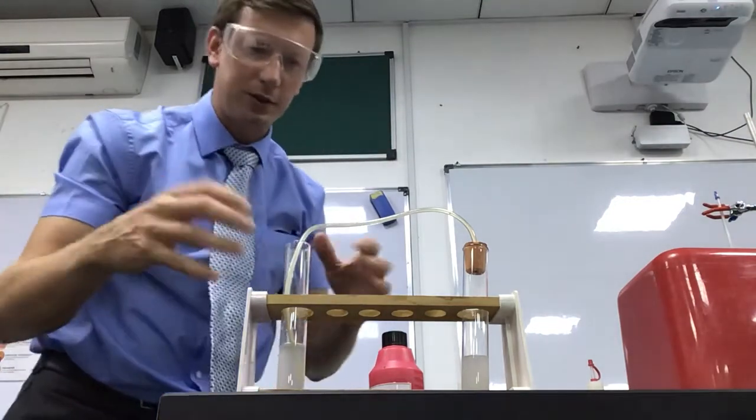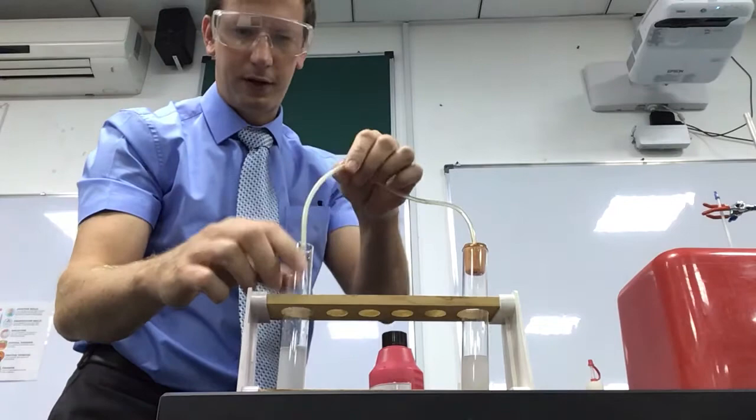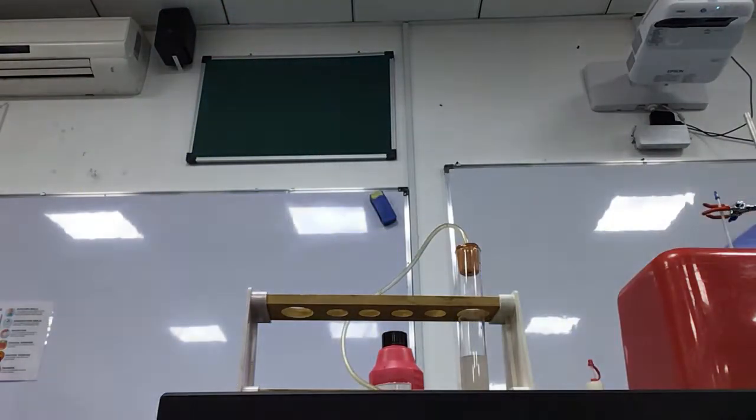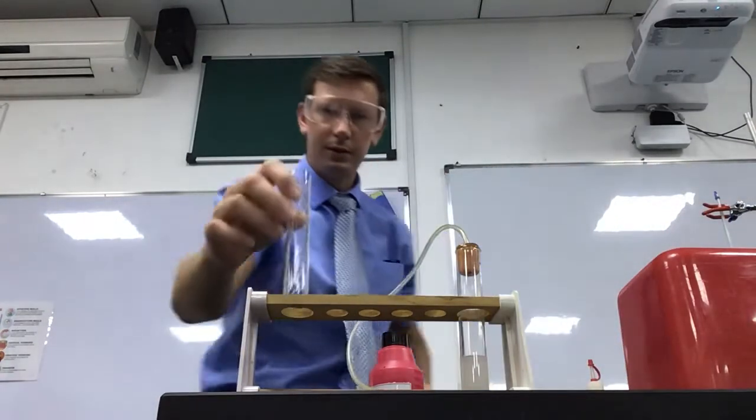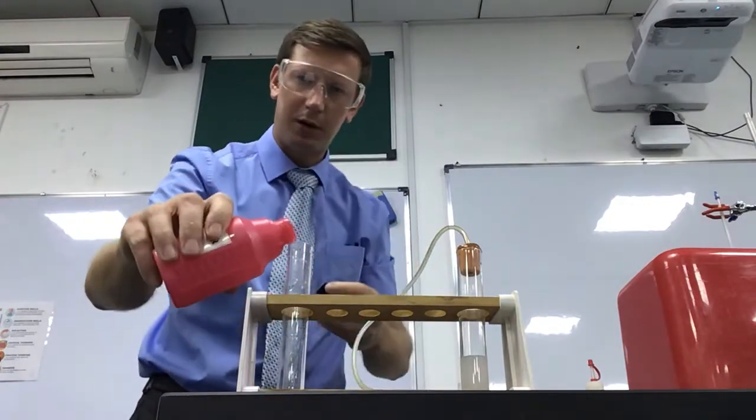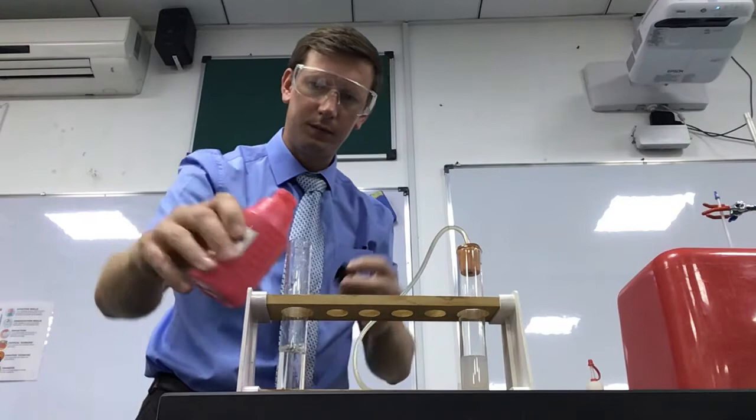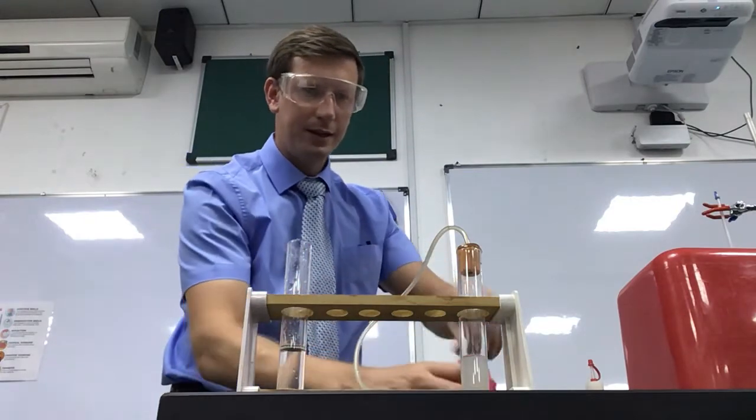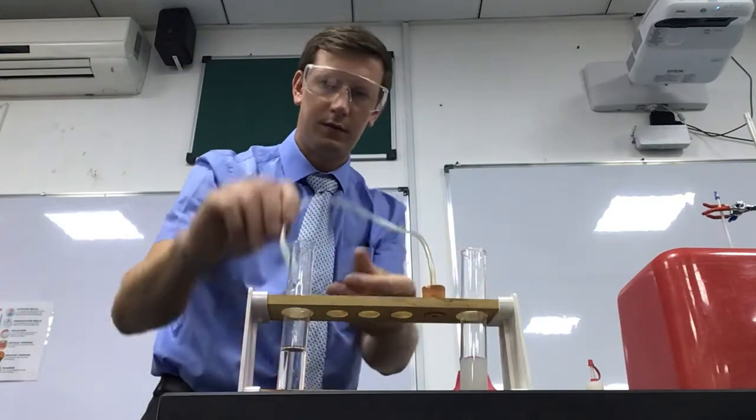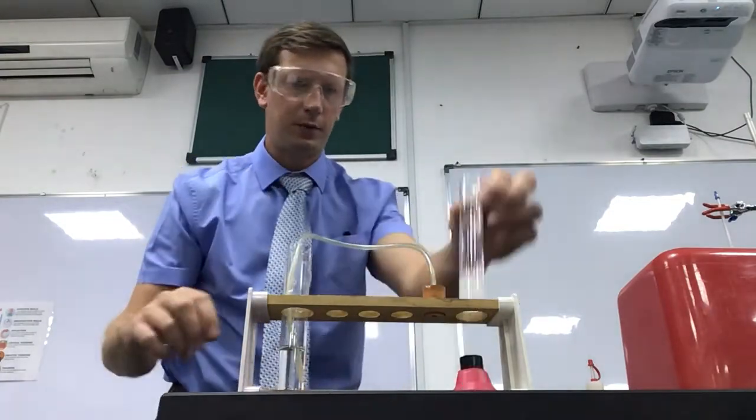In my next experiment, I'll just give this all a quick clean through. I'll have some fresh lime water. Fresh lime water for the next experiment.